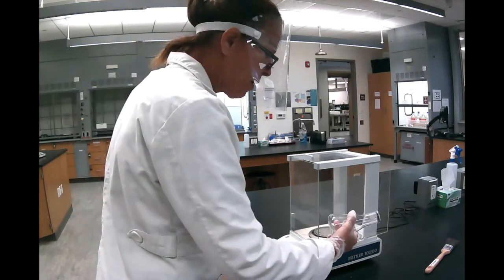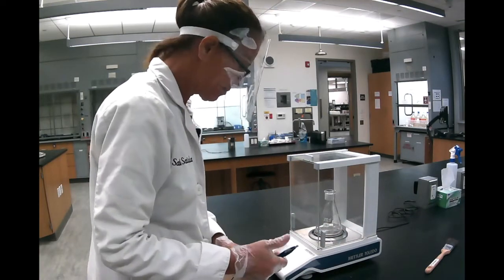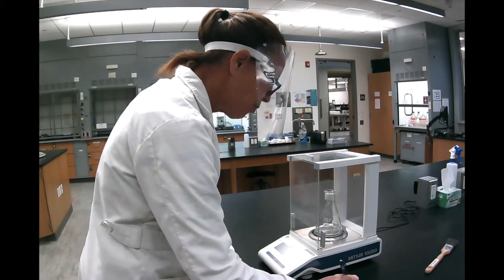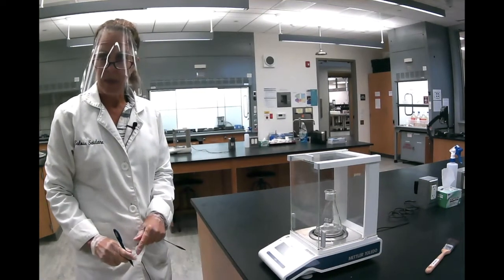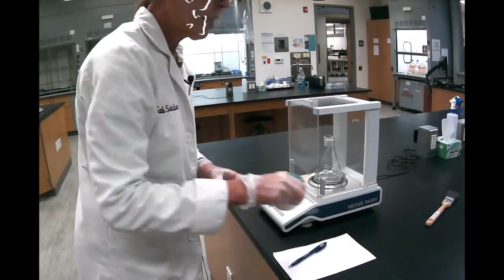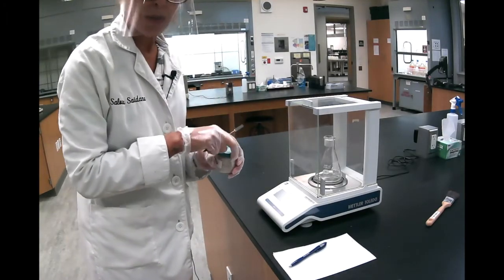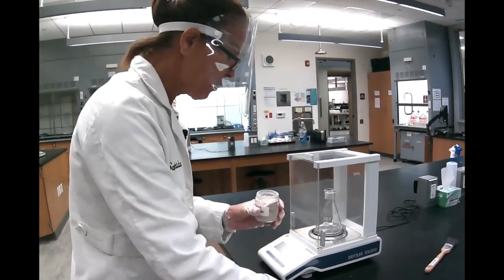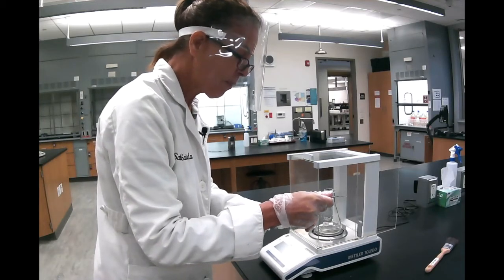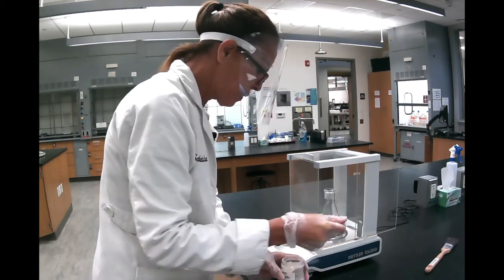So I'm going to weigh the Erlenmeyer flask and write the mass. So for me it's 100.6724 grams. And then we're going to add about 1 gram. What matters is you weigh about 1 gram, but you need to know the exact amount you put in your flask. So how do we do this? You always grab a tiny amount with the tip of your scoopula, and you're going to add at the beginning.